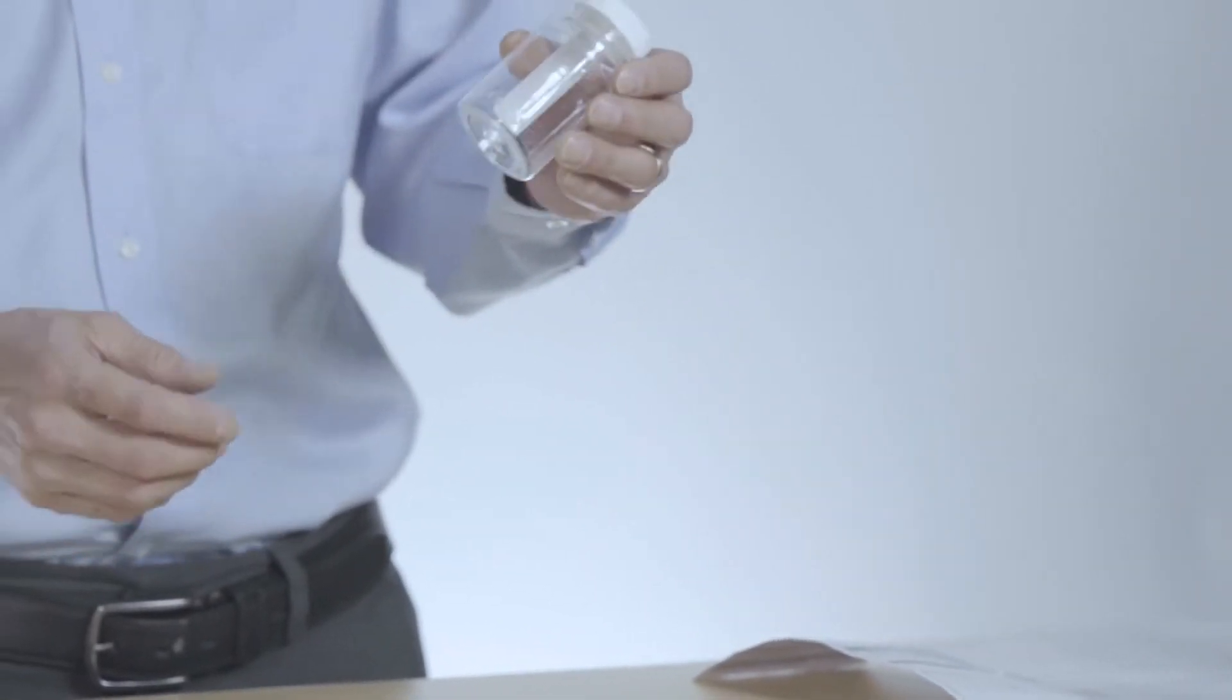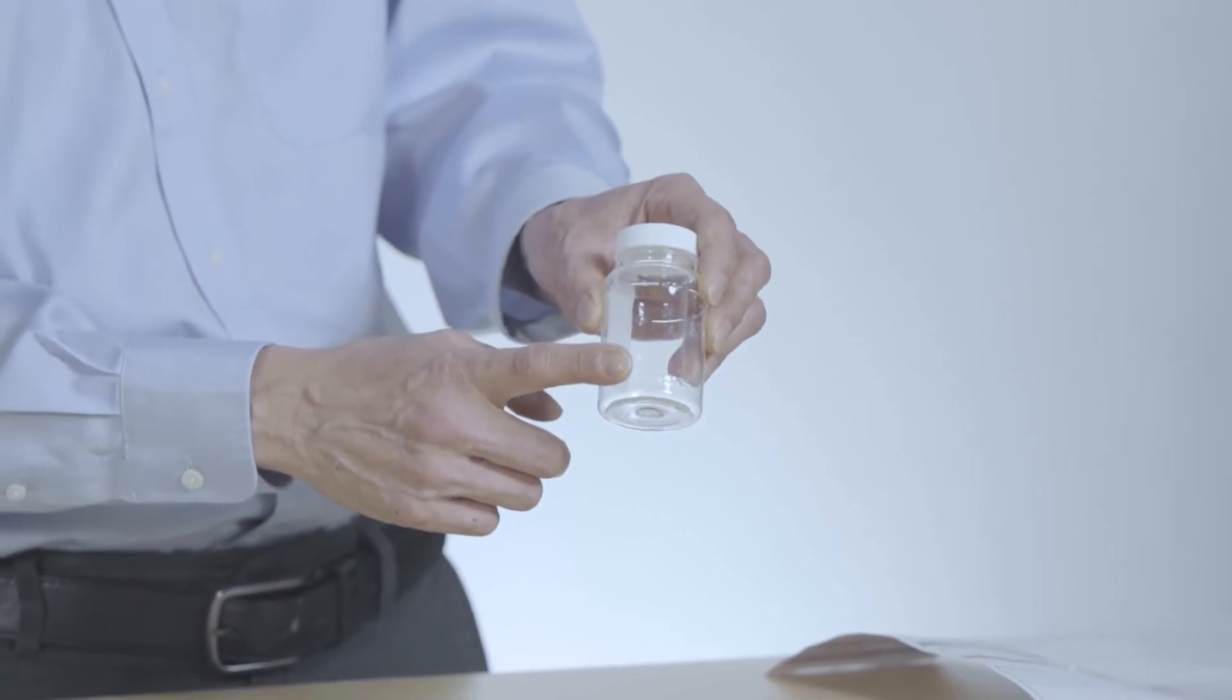Here is our sample bottle. It's very simple. It has a little white powder in it. That's a preservative for this sample.